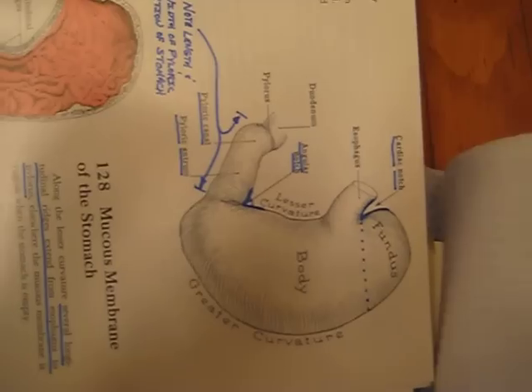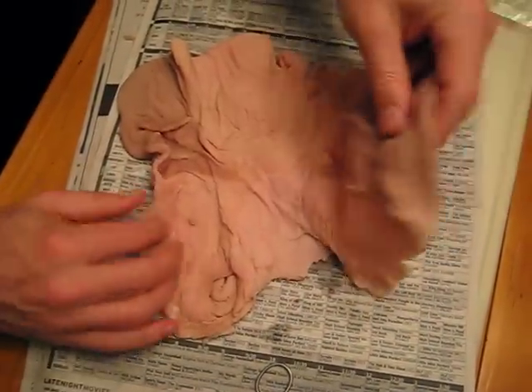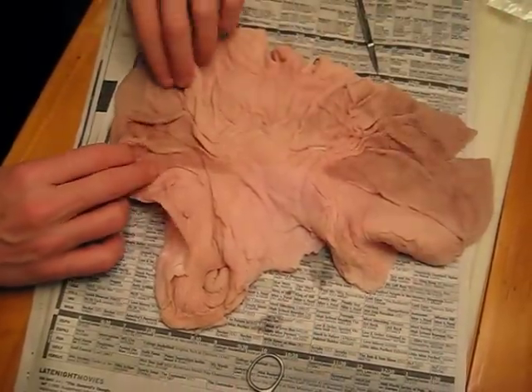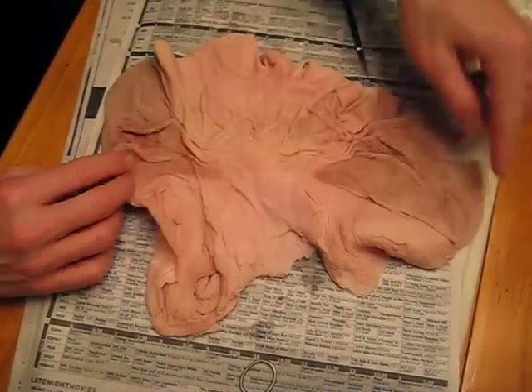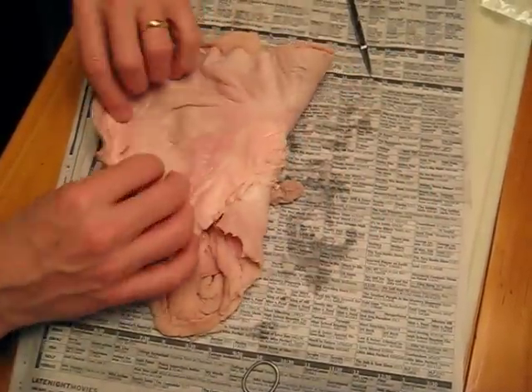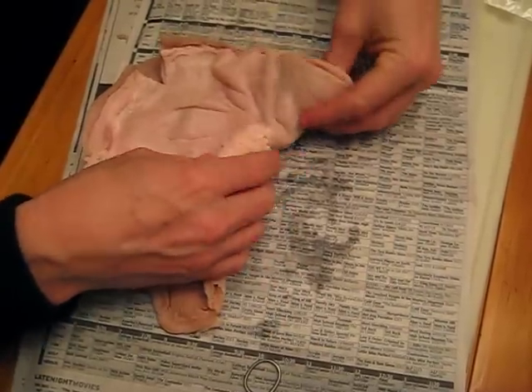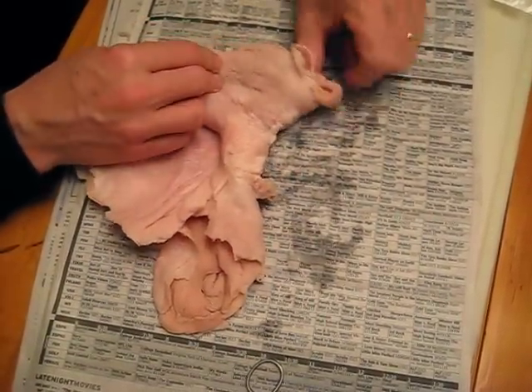The fundus is up above where the esophagus enters, and then you get into the body of the stomach, which is this part, where most of the food is stored. This is where acid gets produced down here, and you can see it over here as well, so it forms the bottom layer of the stomach.